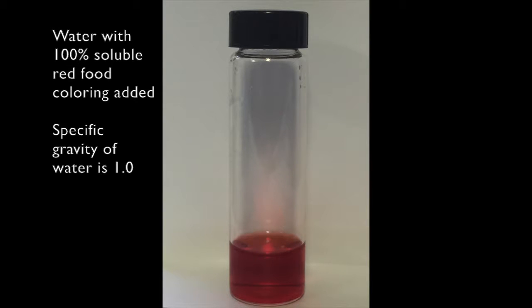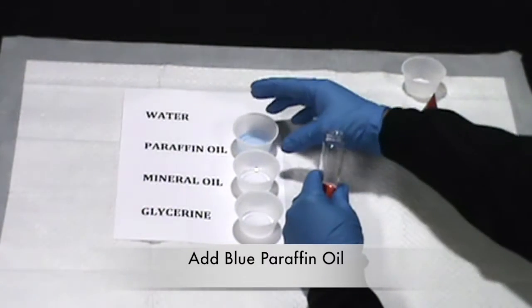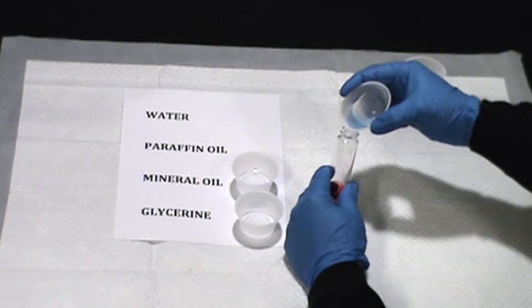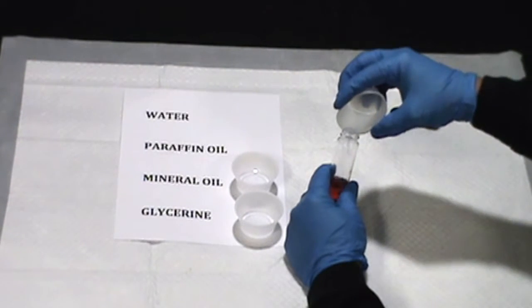The red food coloring has completely dissolved into the water, and we can say that that is 100% soluble. Also, the specific gravity of water is equal to 1. Next, we will add 10 milliliters of blue paraffin oil to the glass vial so we can compare the solubility and specific gravity of the chemical to water.